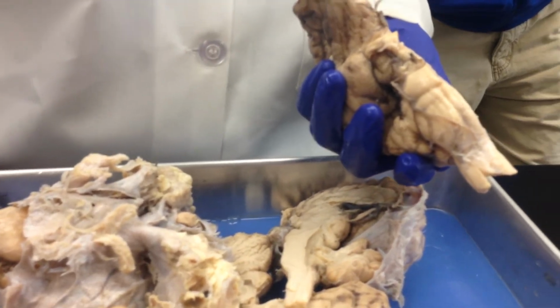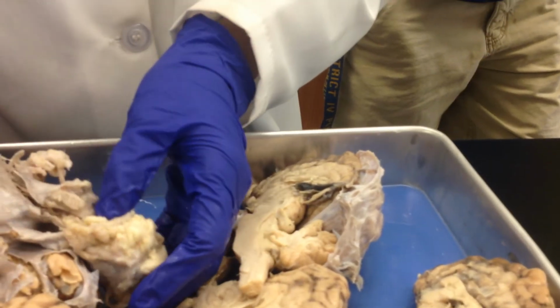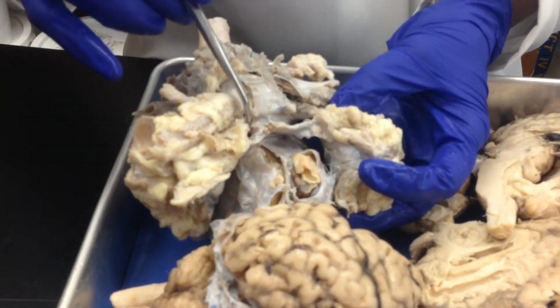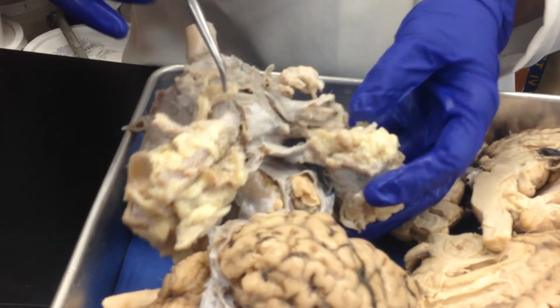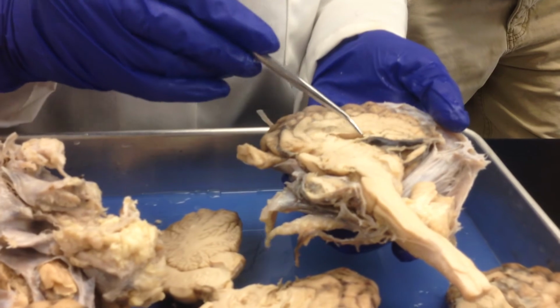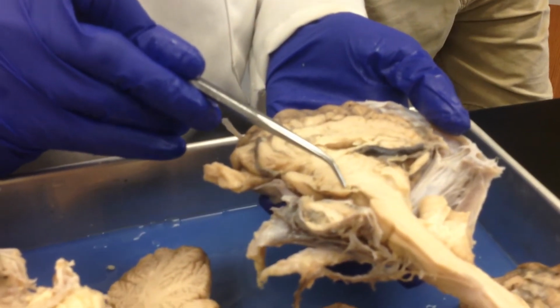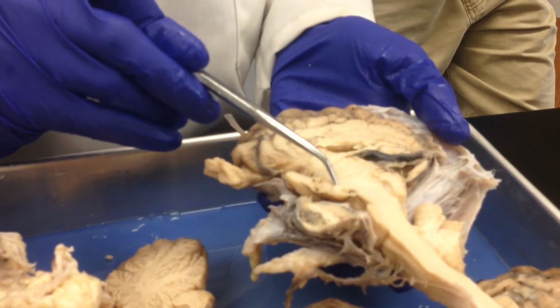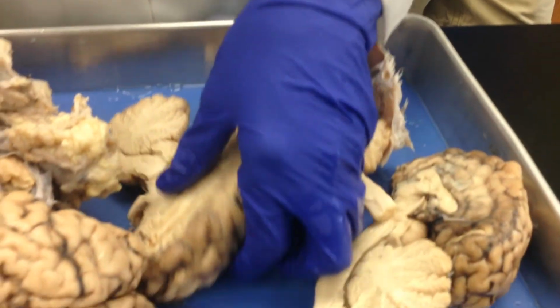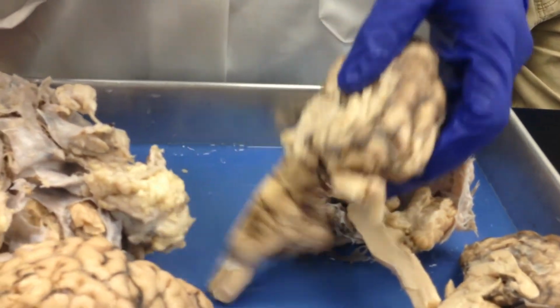Let me see. Did I cover everything? Oh, optic tract. I forgot to show you the optic tract. I remember I told you once the optic chiasma crosses, after that is the optic tract. Okay? So, thalamus, epithalamus, hypothalamus, optic chiasma, and then posterior to that, that's the mammillary body. So once again, you can see the mammillary body on this right there. It's nice and circular. Okay.